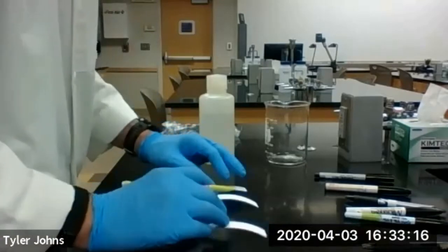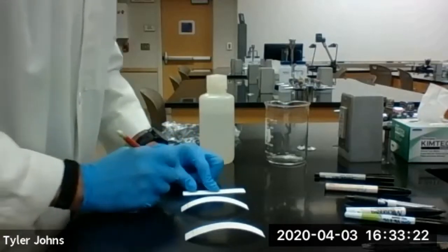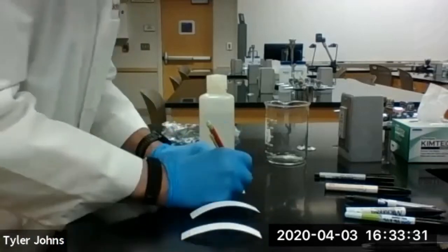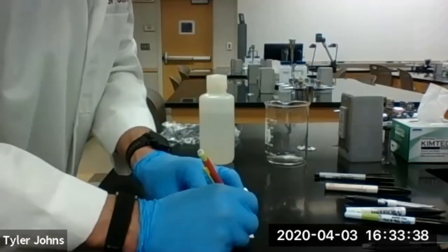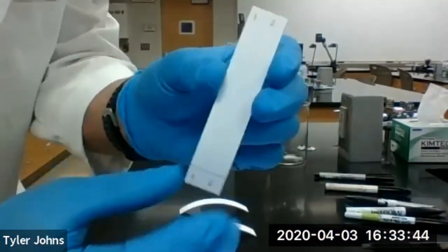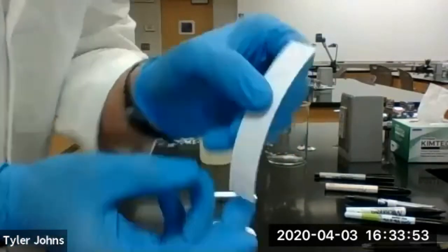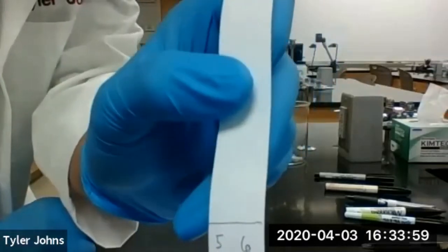At the bottom and at the top I'm going to number our students' pens that are potential suspects. At this point we have our chromatography paper, we've drawn a line one centimeter up from the bottom, and we've numbered one and two on this one, three and four, and five and six.